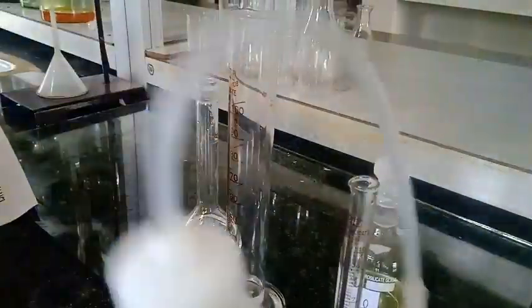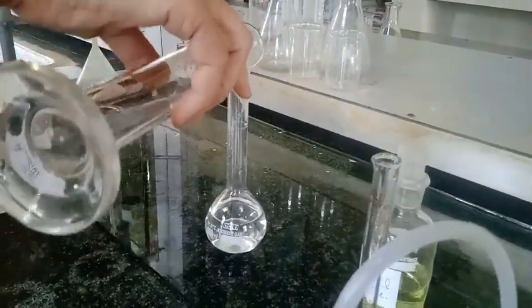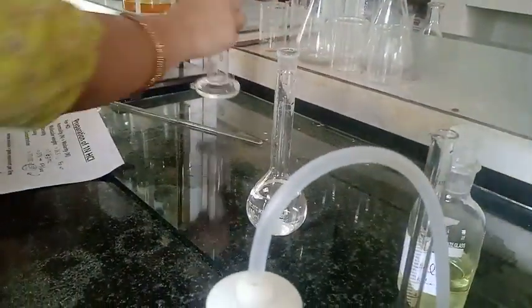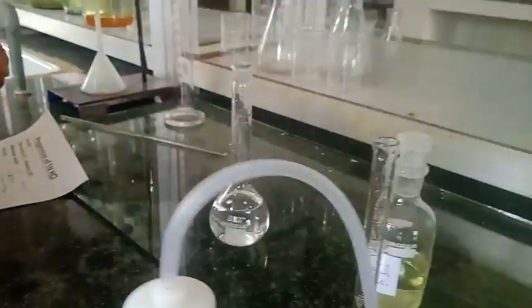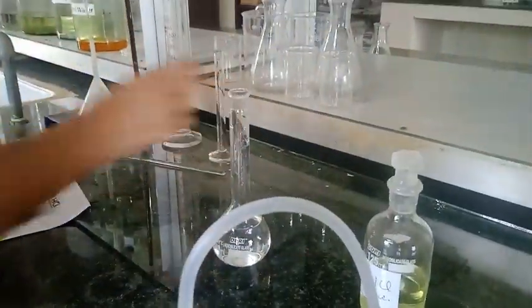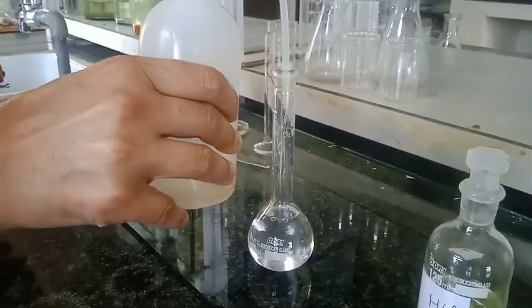So I am going to rinse it and I will add to this measuring flask. I again rinse this, transfer it to measuring flask and now I will transfer this solution to the measuring flask because I need to prepare 100 ml of this.